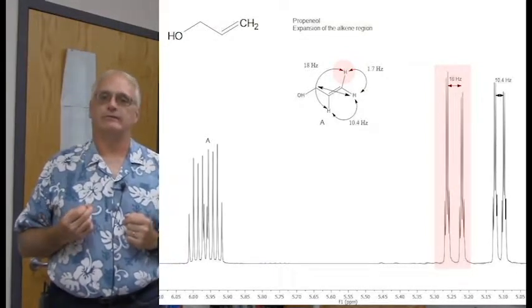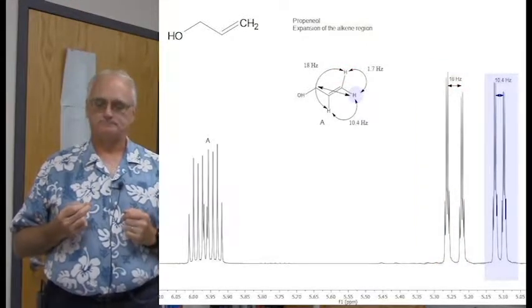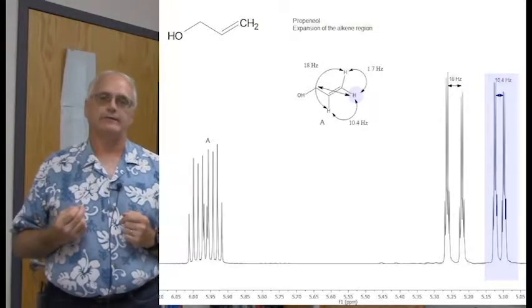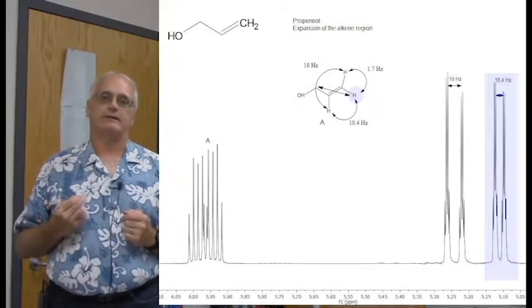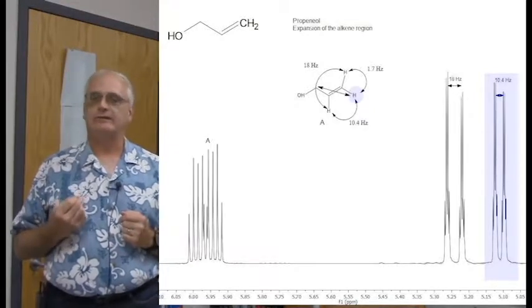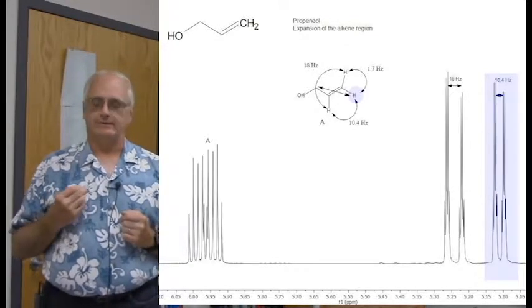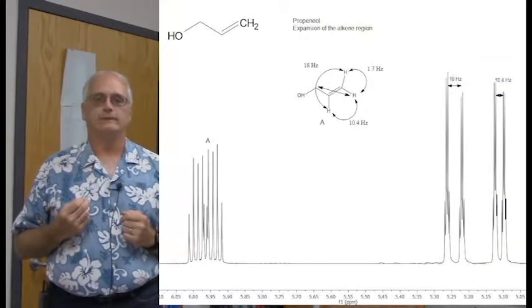And that's exactly what we see. Over here we see the cis proton. It is a big doublet. It looks like a doublet of quartets. Once again, it's not as widely separated. Here we see about a 10.4 Hertz cis coupling constant, large, but not as large as the trans coupling constant. So here are the two protons of the CH2 group, nicely separated from each other.